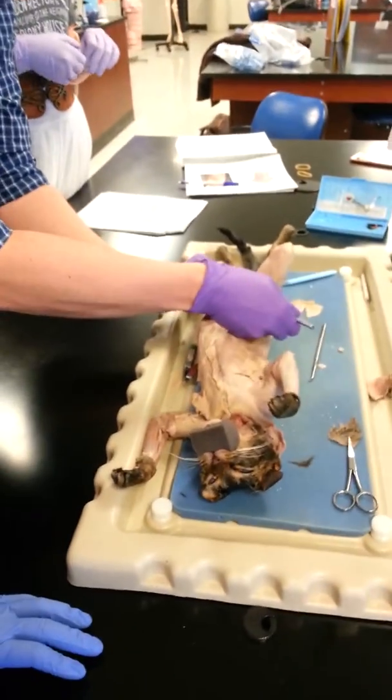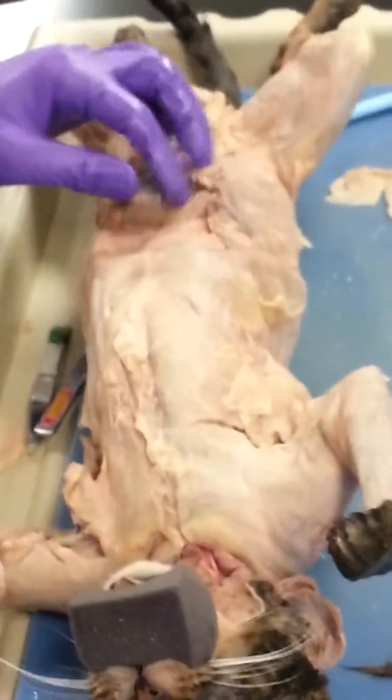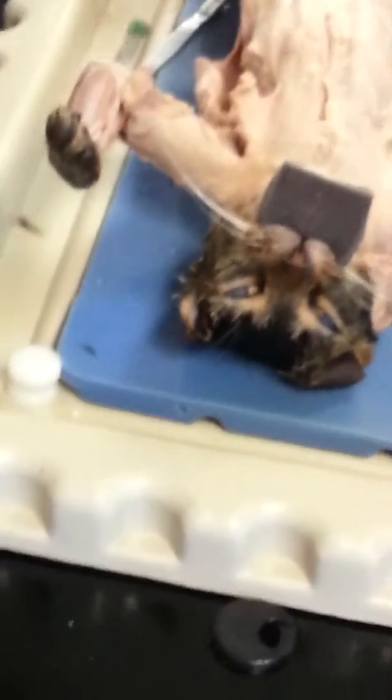External obliques. Comes down again. They're outside. These are internal. That's also the other thing we know, because you're going to see a flap pulled back. And they're going to be going out internal. Inside. And then, what about this one?